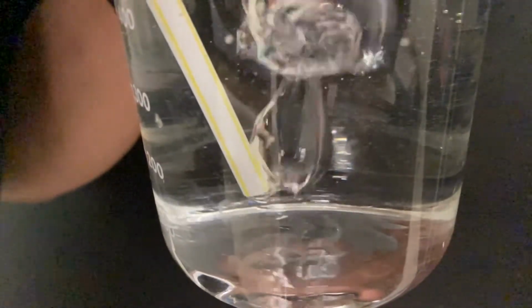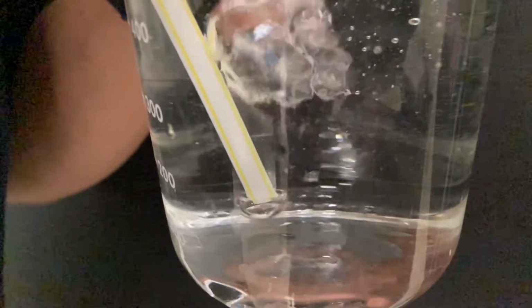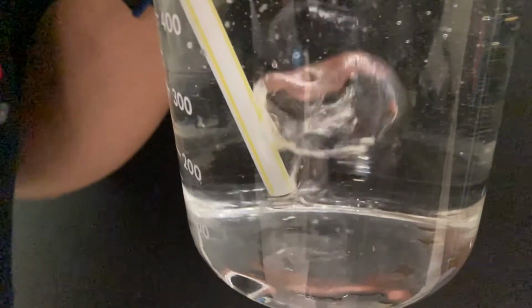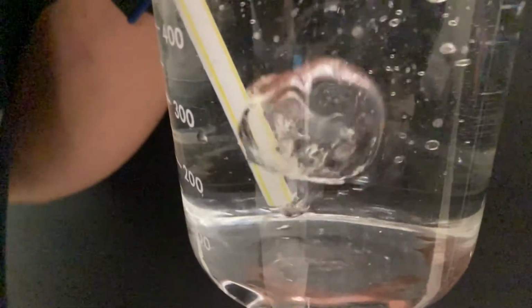Hopefully you've all had a straw and you've blown bubbles. My question is, what are in the bubbles? Most people will say that the bubbles are filled with air, and that's a good answer. A slightly better answer is that they're filled with gas, because that's more general. The real question is, what kind of gas? Today we're going to look at chemical reactions that generate 3 different kinds of gases.